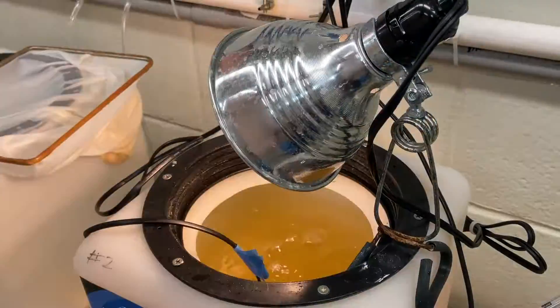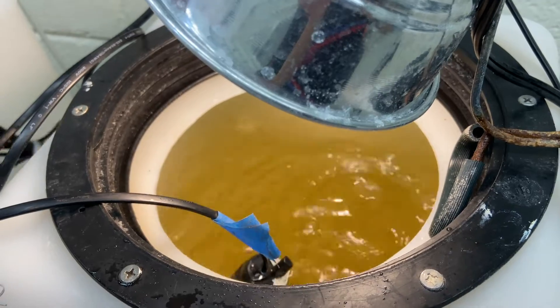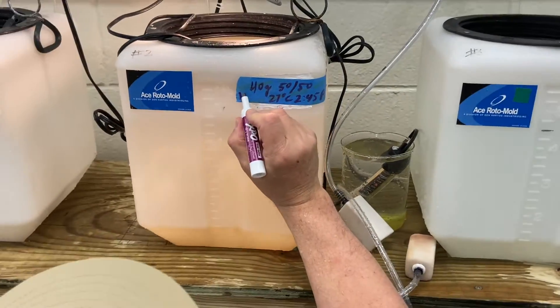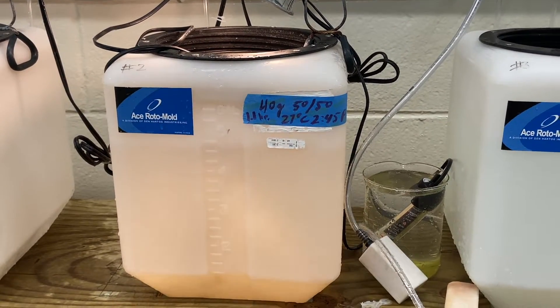Here we're getting ready to hatch the cysts. We note the gram amount of the cysts, the solution which is 50-50, the temperature at 27 degrees Celsius, and the time at which it was done — 2:45 PM. In one day, 4 million baby artemia will be hatched.